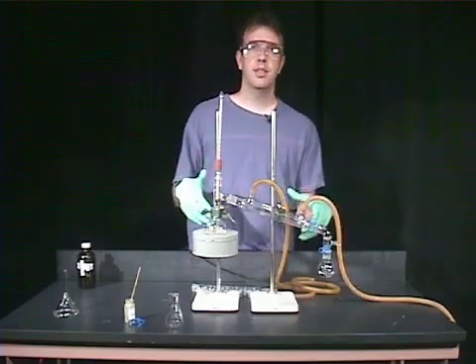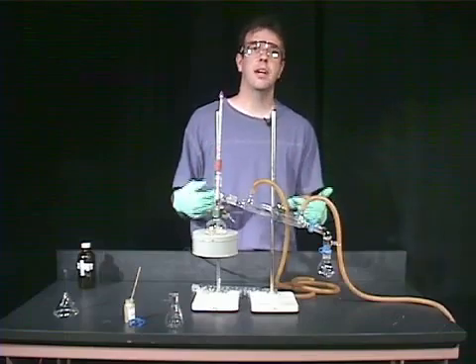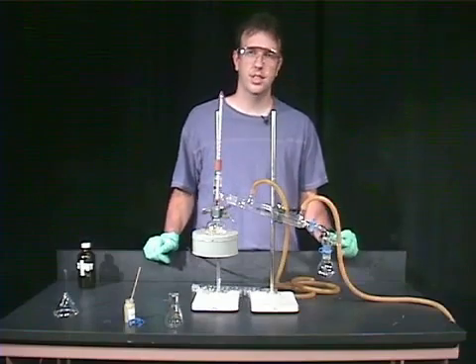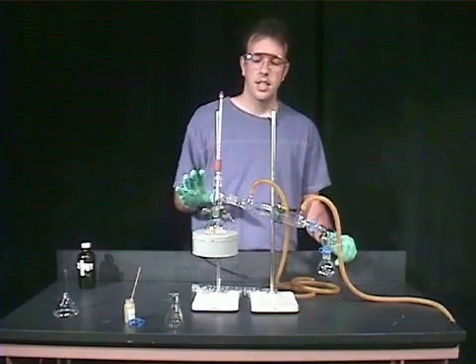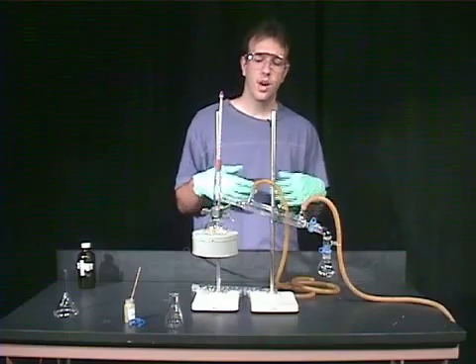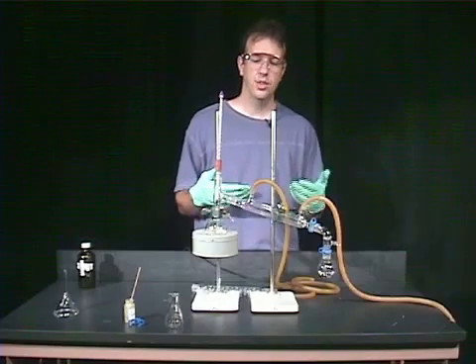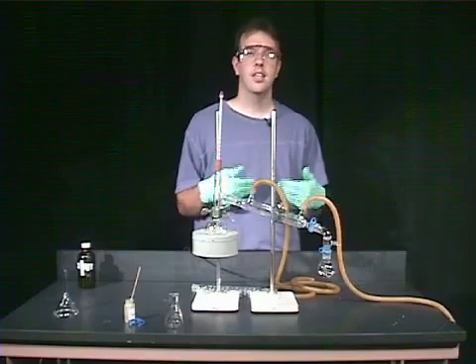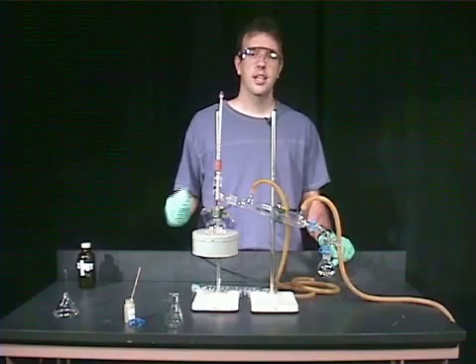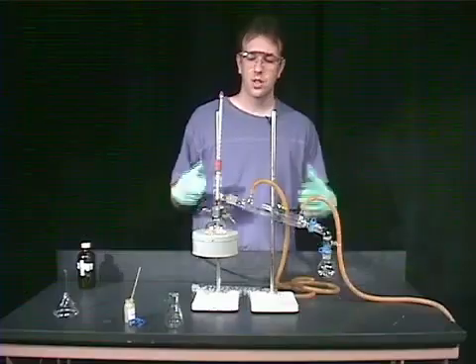So I'm going to stop this and show you how to modify this experimental setup for what is called fractional distillation. Simple distillation is for the separation of liquids where the boiling points are at least 60 to 70 degrees different from one another. Simple distillation is for purifying solvents that you're going to use in a reaction. But generally, we're going to use fractional distillation in the lab to separate or purify out material.